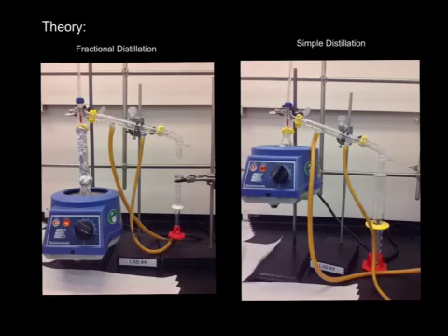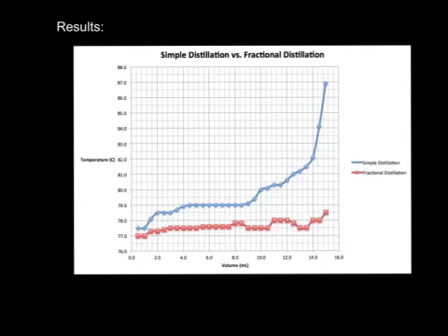On the other hand, fractional distillation, as shown on the left, allows multiple theoretical plates to occur with the use of the glass beads, which increases the surface area within the distilling column. This allows the vapor to condense on each individual glass bead, giving a pure concentration of ethanol after condensation into the distillate. The only real problem with this is that it takes longer than simple distillation just because the theoretical plates are multiple within the fractional distillation. Throughout the experiment, the student recorded the temperatures at every 0.5 milliliters for a total of 15 milliliters when distilling the alcohol.